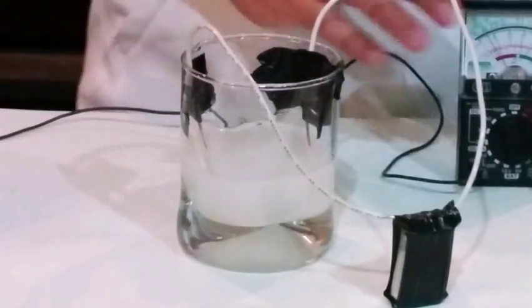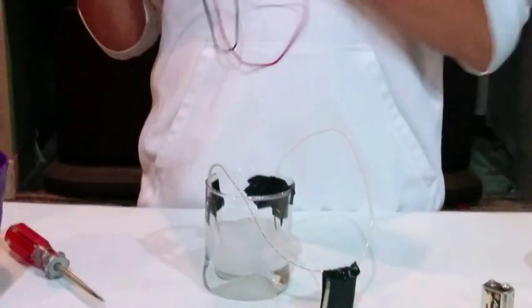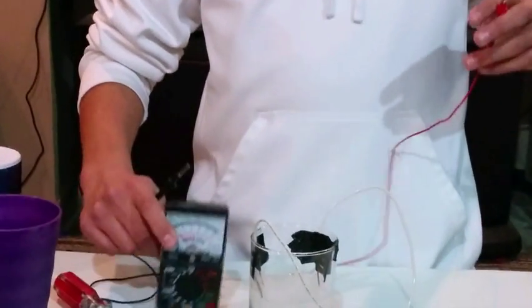And now we're going to test the conductivity of the salt water using this battery tester. If there is a connection, this meter will move.